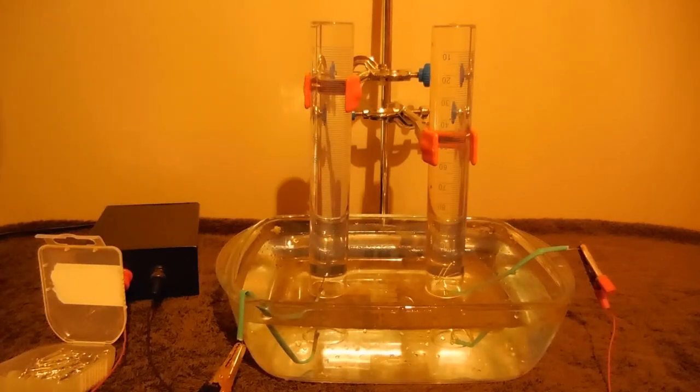Hello. In this experiment I will show you electrolysis of water with iron electrodes.